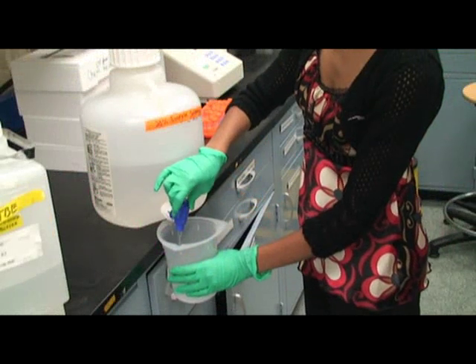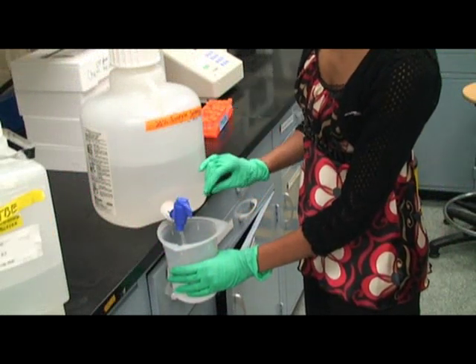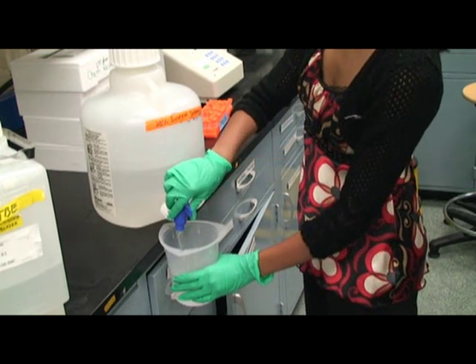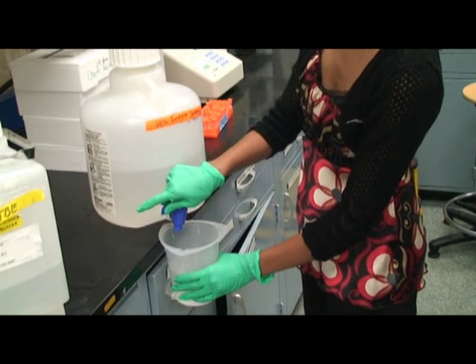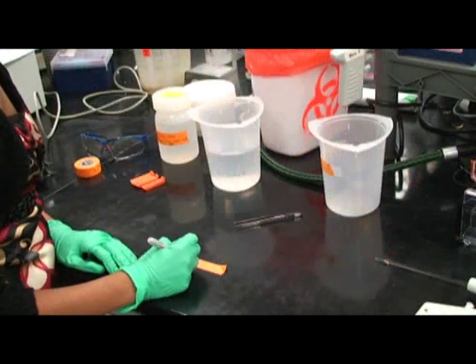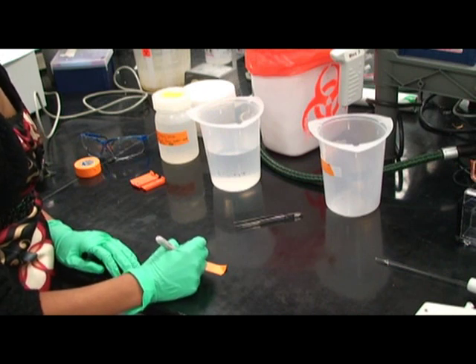Fill the beakers with the appropriate solutions. Be sure to label each beaker.